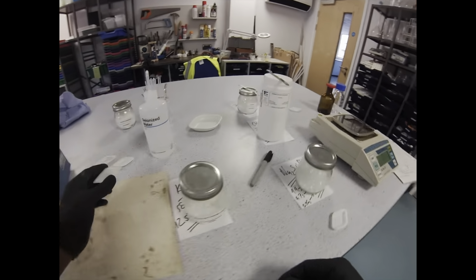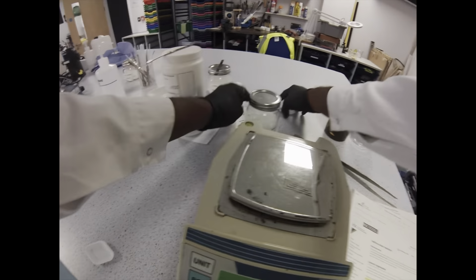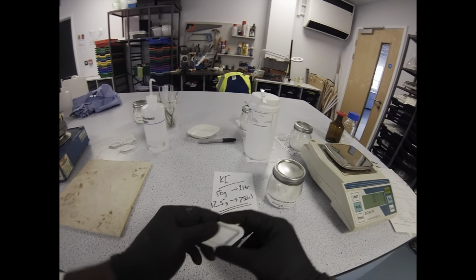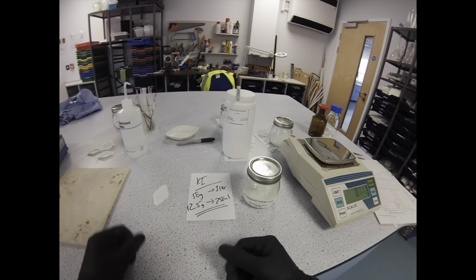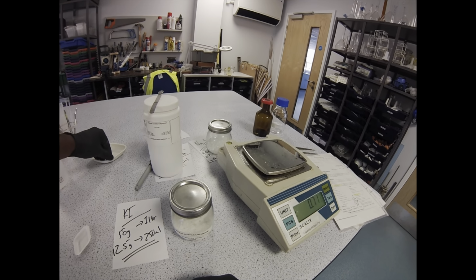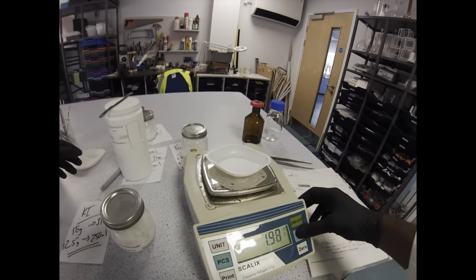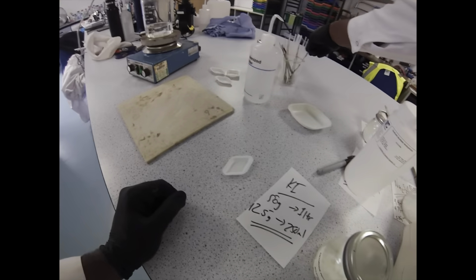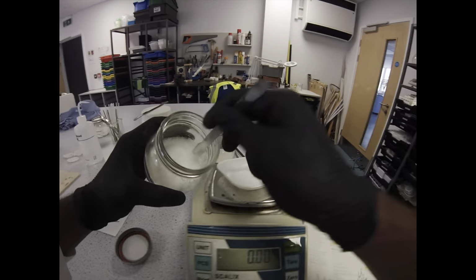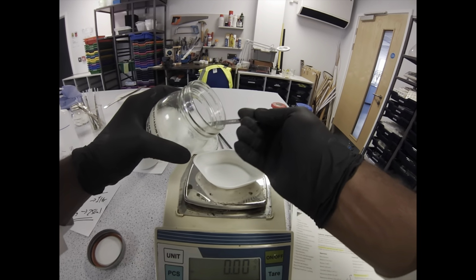And so now we're done with our sodium thiosulfate, so it's time to do our potassium iodide, our KI. The price of potassium iodide has gone up astronomically since I started. I know that the price of all chemicals has gone up over the last 10 years, but potassium iodide in particular has just gone up astronomically for a chemical that is part of our bread and butter at school. Very, very annoying, very frustrating, especially when you're using so much for one demonstration. So try and get the most out of this demonstration, try and use it as much as we can.